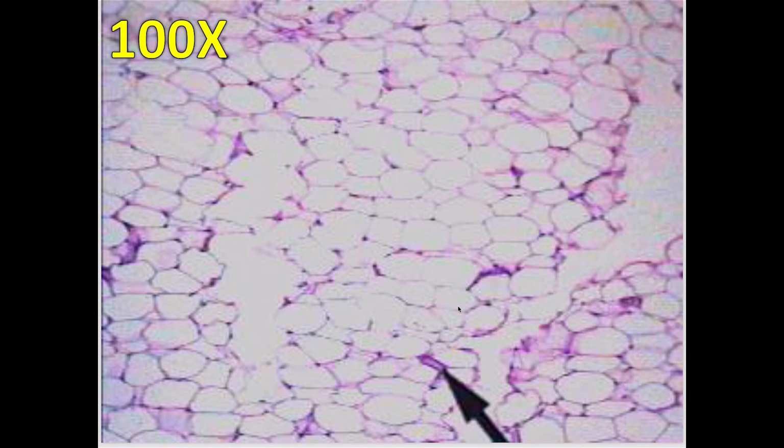So what I had to do in order to get this picture actually was to lower the diaphragm, the condenser in the microscopes, to let in as little light as possible. And I also had to put a piece of dark tissue paper over the light source to shade it enough in order to be able to see this. So again, if you sit down at a microscope and you think you can't see anything, look closely and you will see this honeycomb-like effect. That is very, very indicative of adipose tissue.